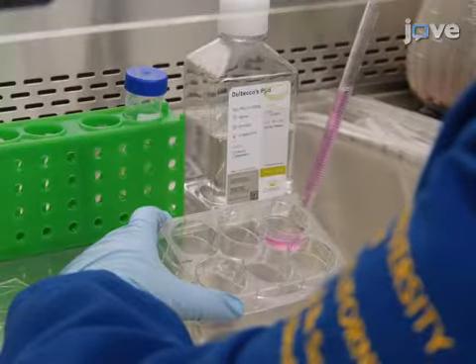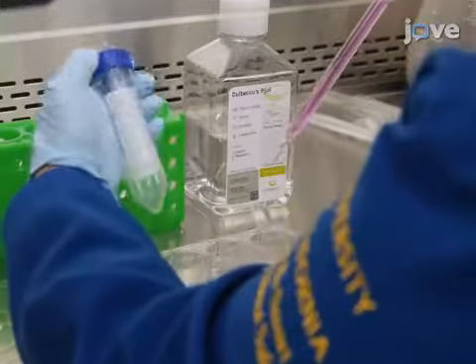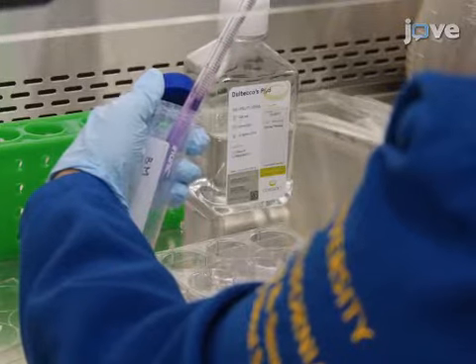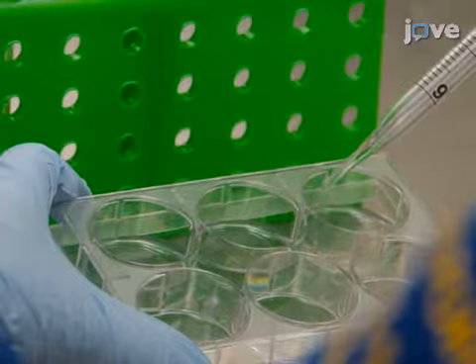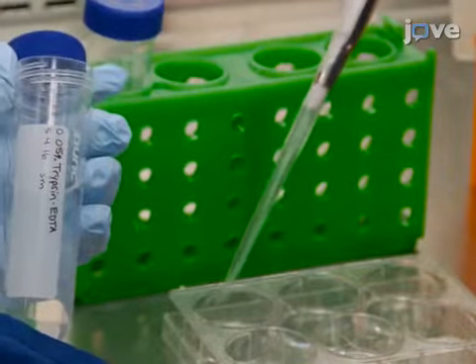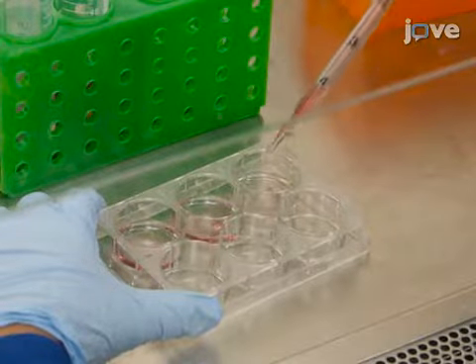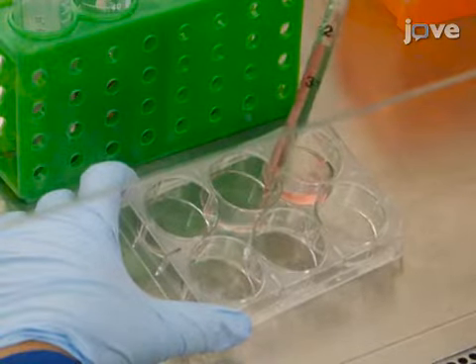After preparing recipient mice for transplantation according to the text protocol, harvest transduced donor cells from the 6-well plates by gently pipetting supernatant into conical tubes. Use 1 milliliter of PBS to wash each well and collect the residual cells in the tubes. Add 0.5 milliliters of 0.05% trypsin to the wells and incubate at 37 degrees Celsius for 5 minutes. Next, add 1 milliliter of D10 to the wells and detach any remaining cells by gently pipetting.